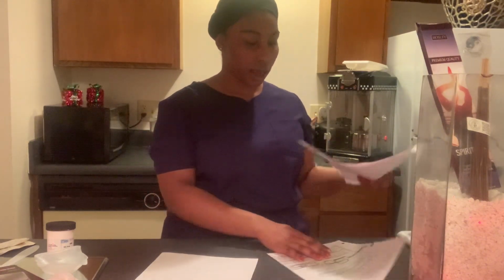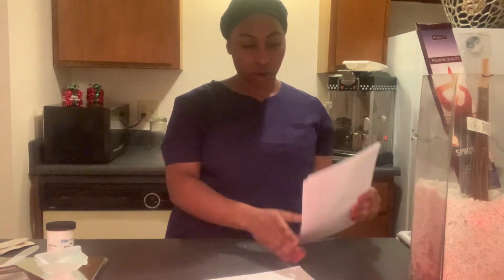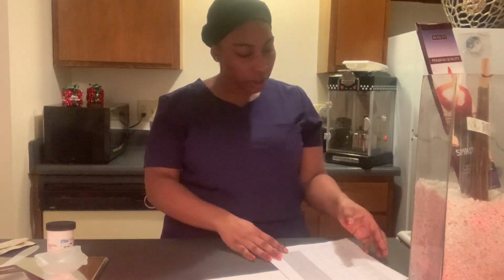Put this to the side. And then we have our prescription, and we can start beginning doing what we're supposed to be doing. So gather the necessary materials.